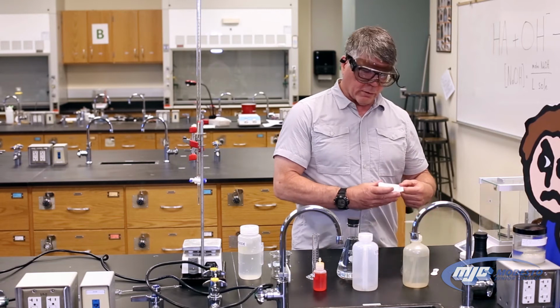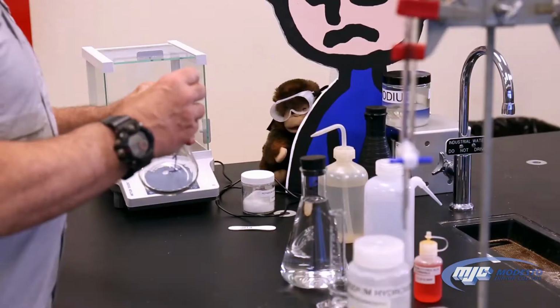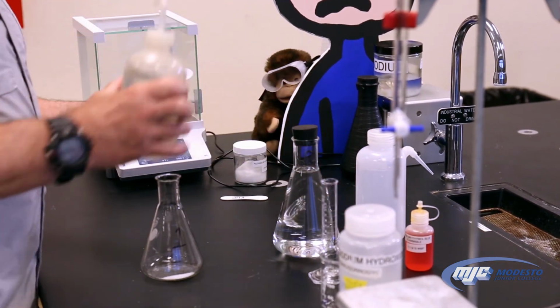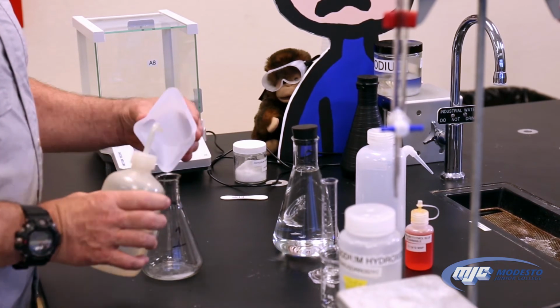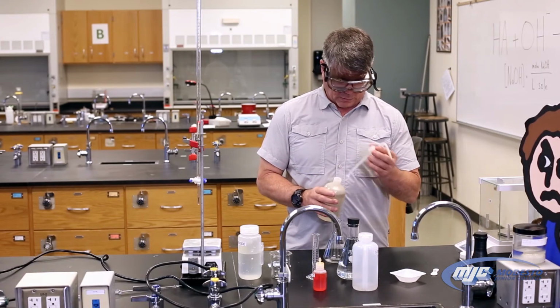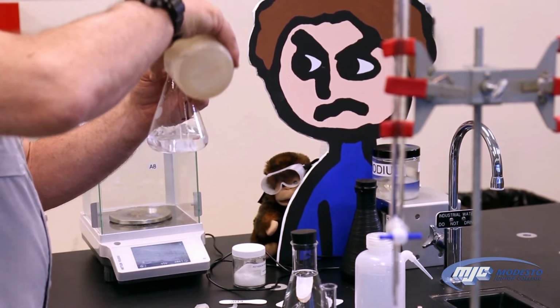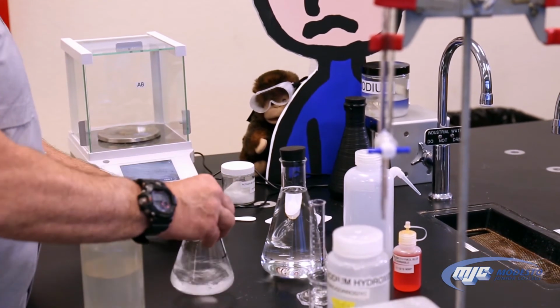So we'll have 3 Erlenmeyer flasks. We'll have labeled them ahead of time, 1, 2, and 3. I have number 1 right here. Add the KHP to that. Because we weighed that out, we want to make sure we get all that KHP into that flask. So we're going to rinse it with a little bit of deionized water. Make sure we get every little bit of that in there. And then we're going to add about 50 mils of DI. This is not worth measuring because that volume doesn't really matter. So I'm just going to eyeball it. Say that's about 50 mils. Give it a little swirl, let it start dissolving.